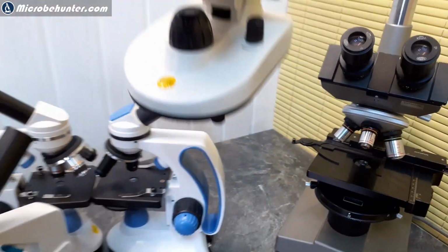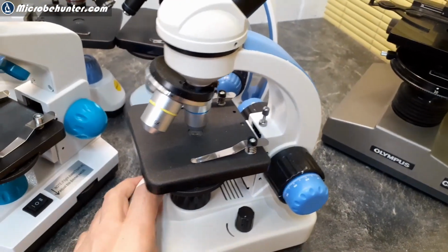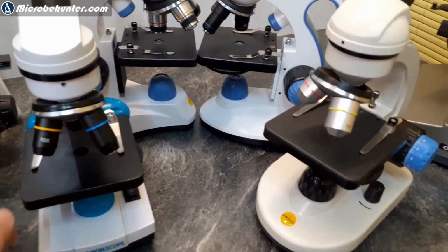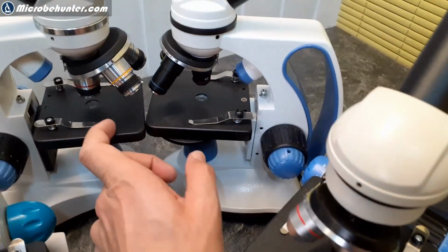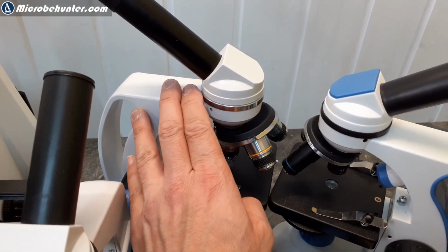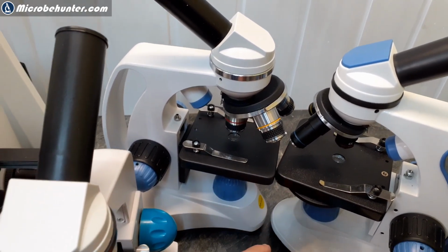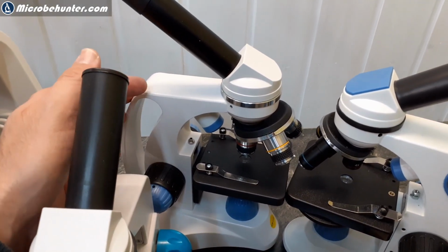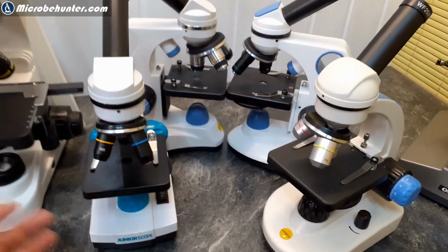It's the National Optical or Swift SS110, again, very similar. Now, if you look very carefully, there is an interesting difference here. Not that this makes a huge difference, but something noteworthy. The stage all looks the same here, but this one is plastic, and this one is made of metal. And this is also one of the reasons why this microscope here is more expensive. It's not only more expensive because of the larger objectives here, but also because it has more metal parts. But again, you might not be able to notice that when you simply read through the specifications on Amazon.